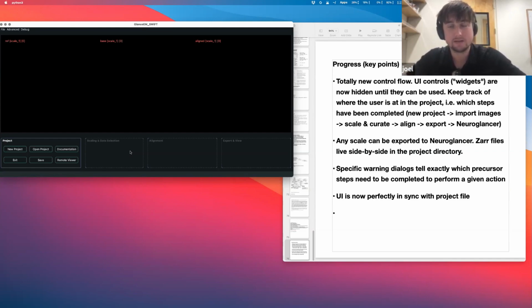So scaling and data selection, I consider that to be one step, the first step. Then step two is you align your images, and that comes with its own set of controls that have no bearing on the other steps. And then the final step is you have to export it to Zarr, and this is step three, the final step, export and view. So export to Zarr and then view in NeuroGlancer.